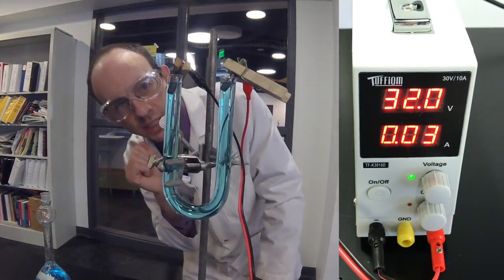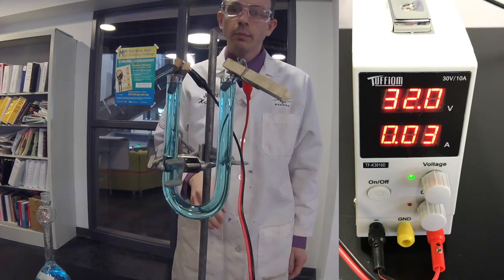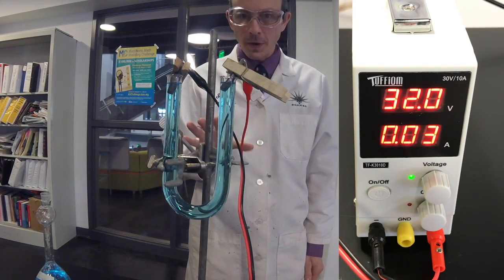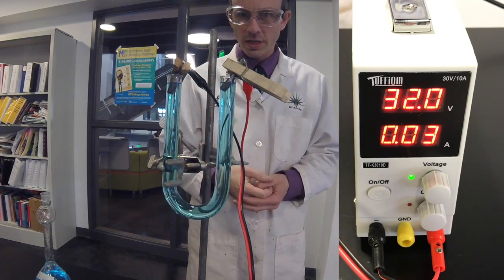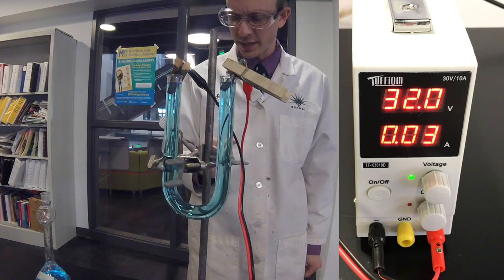And then we don't see much happening on the black side, but that's okay because we're just going to let this roll a little bit more. And then we'll take a look at if any of the copper actually formed on this black side here.